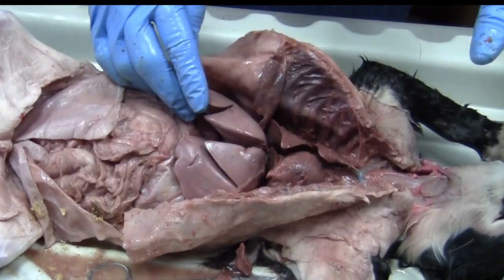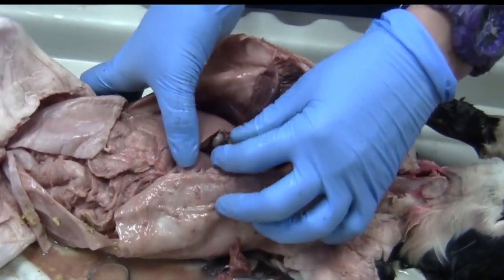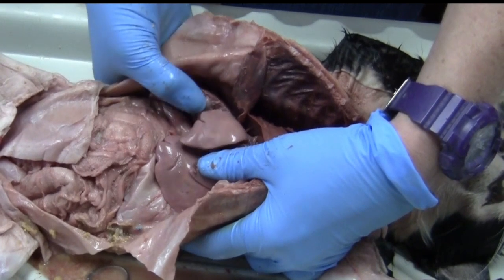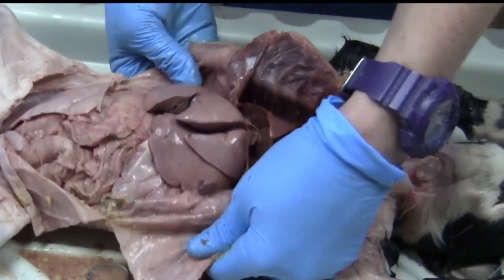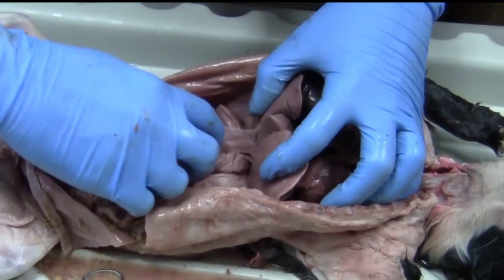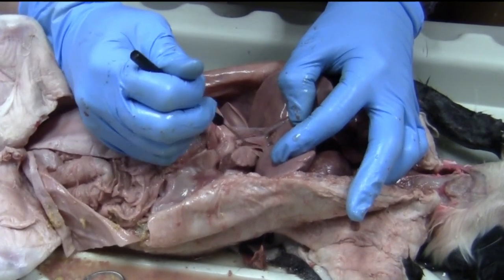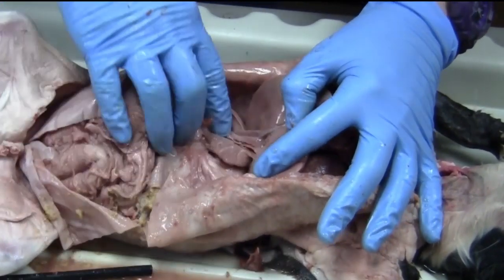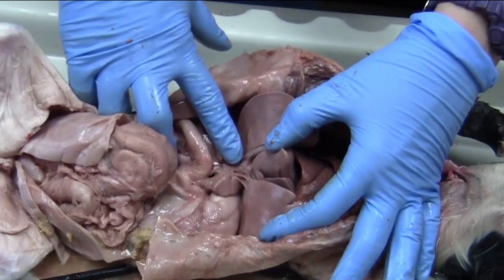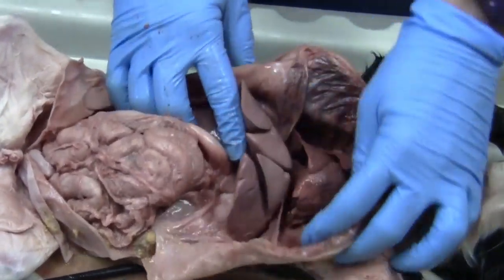And then if we go into the liver just a little bit, here's what we call the gallbladder. So you kind of have to dig a little bit when you go into the liver. The gallbladder kind of sits in one of those big lobes. And the liver does a lot of filtering of blood, and it filters a lot of the blood that comes from the digestive system. So you actually have the portal vein, this one's actually not dyed, coming from the small intestines into the liver. So right here by my finger, there's the portal vein, and it's carrying all the nutrients and all the good stuff from your intestines into your liver.